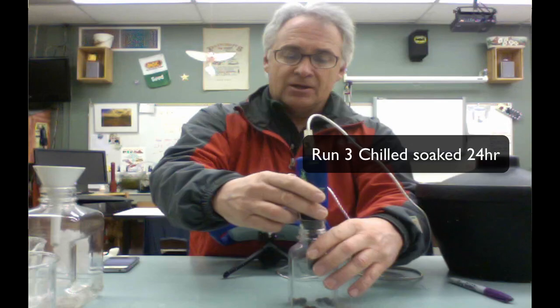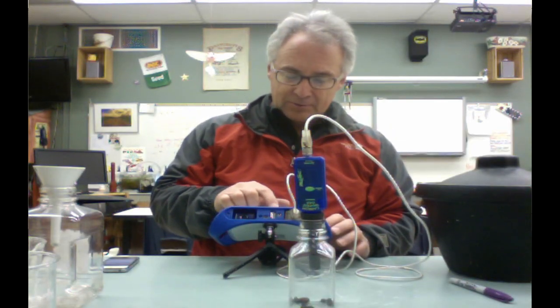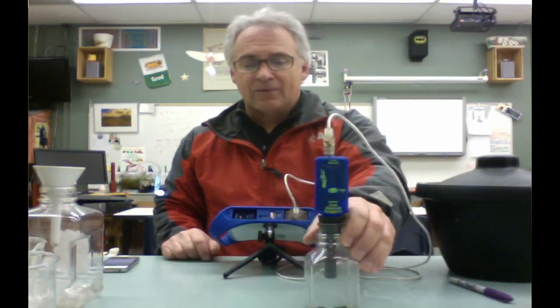Put that right in there. You could actually do 2 of these at a time if you like. And by the way, we're going to go up to the next graph. And that graph is on page 18 of your data logger. I'm going to hit play. And now I'm going to let that go for 10 minutes. So you could actually be doing 2 at the same time.